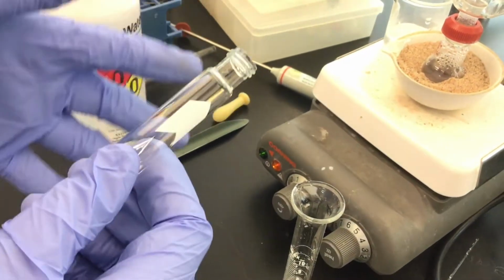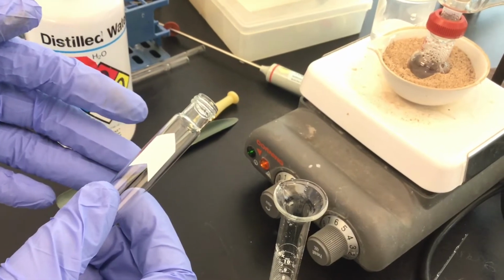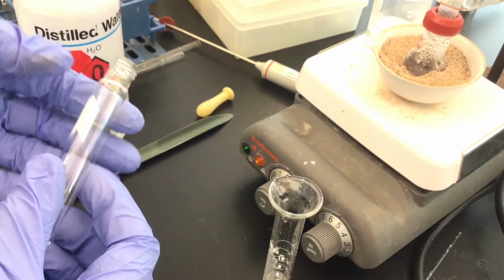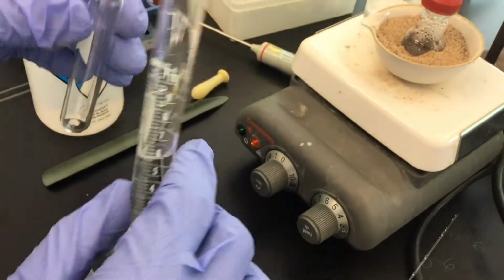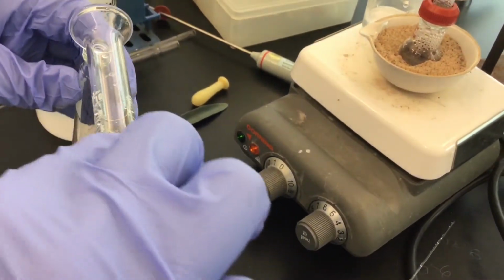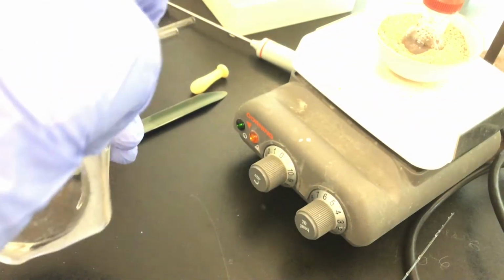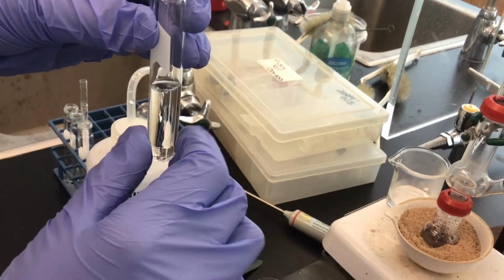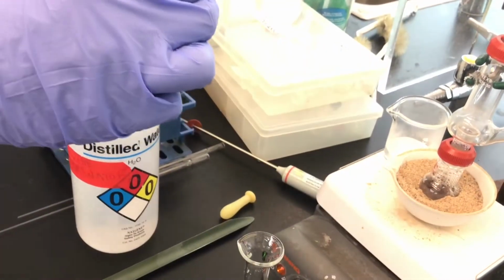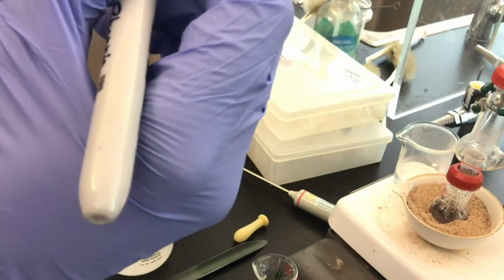And we're going to want to obtain about 6 milliliters of distillate. So how do we know what 6 milliliters looks like? Well, hey, I just put 6 milliliters of water in this. Let's just go ahead and measure what that would look like. So we want to get to about there. In fact, we can even use a Sharpie if we wanted to mark the level at which we're hoping to collect distillate.